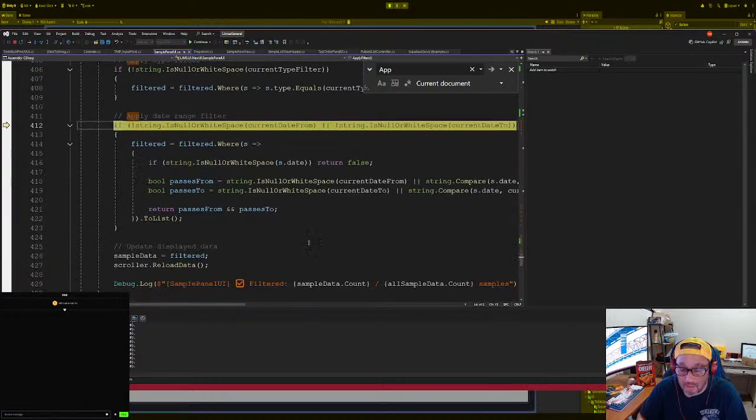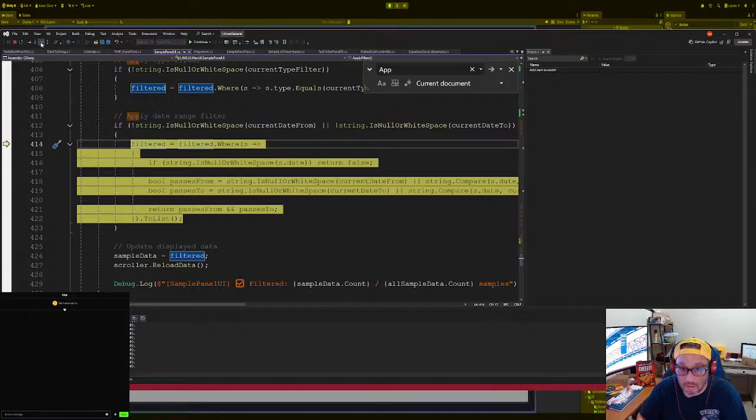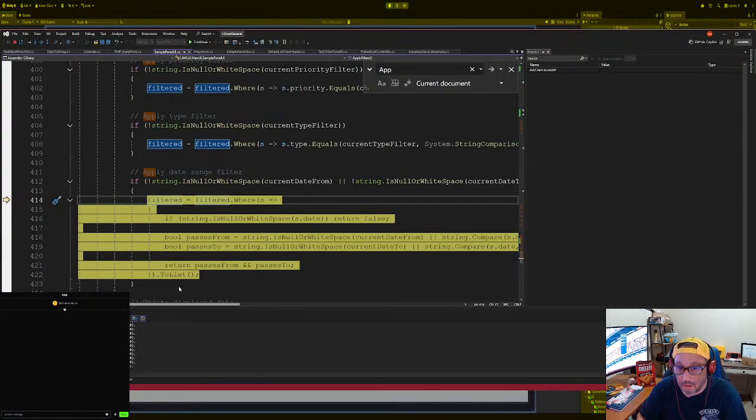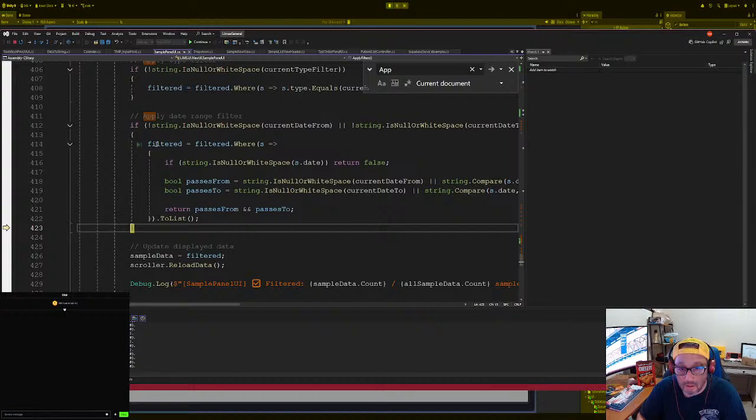Okay, that's fine. Okay, we want to go to the date. Date from, okay, here goes the date. Date from here. Okay, so where is filtered? 50. 50 is filtered out. Why is it filtered out? Okay, something's going wrong here. Filtered 0. Okay.